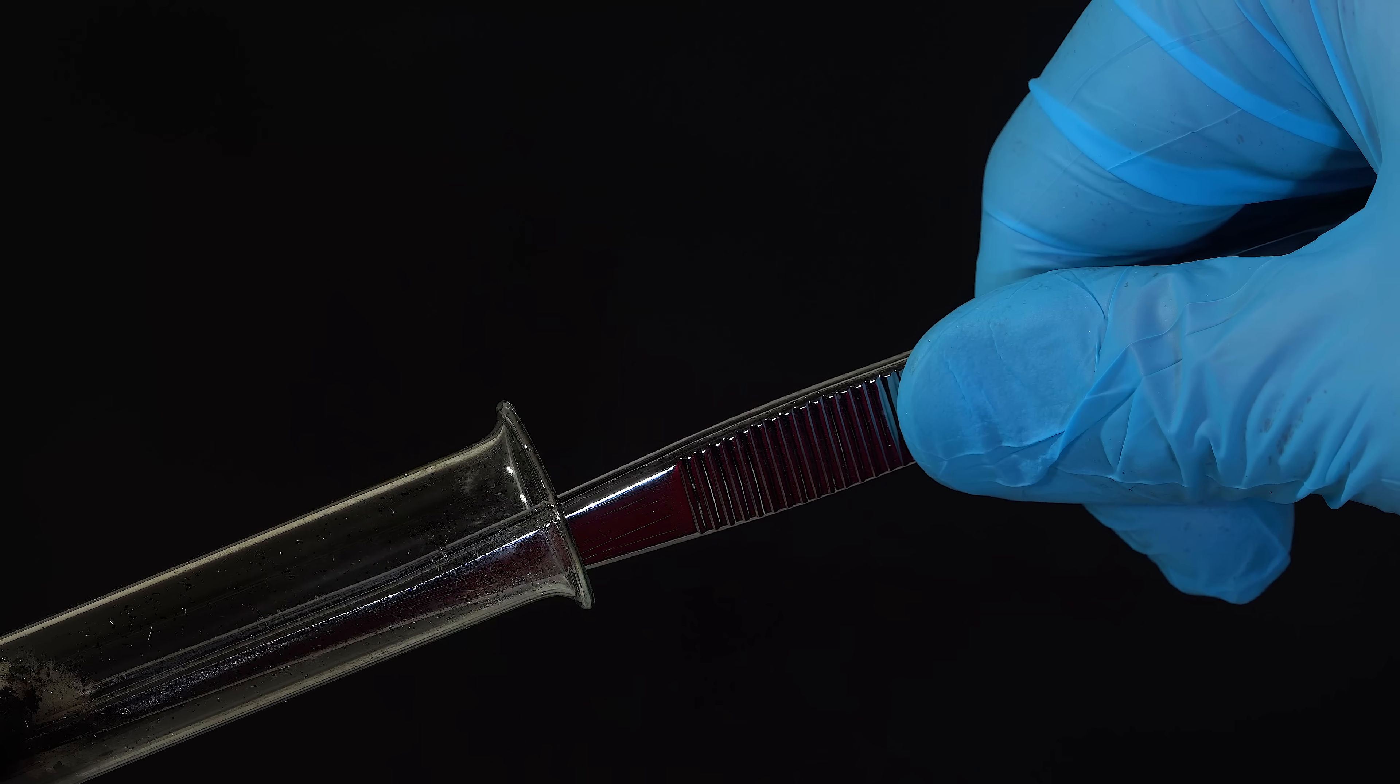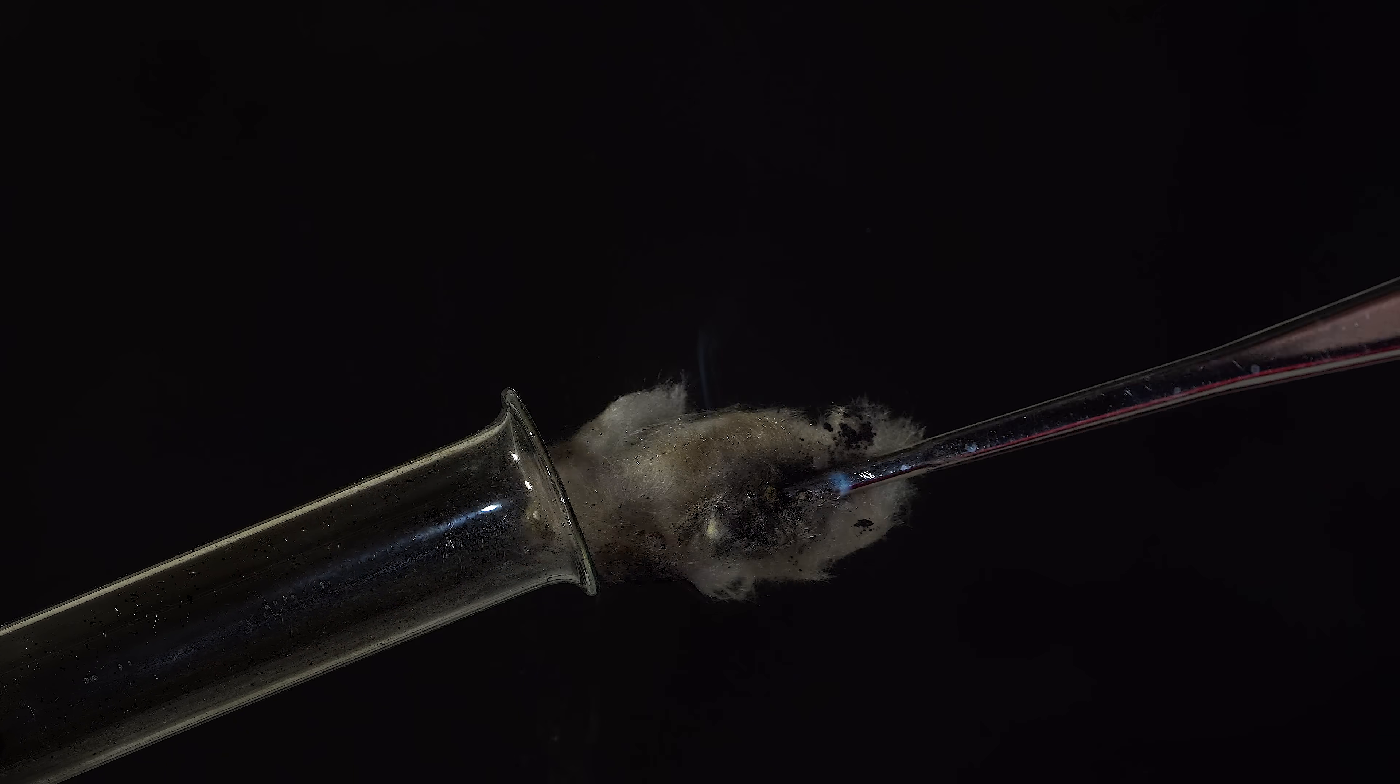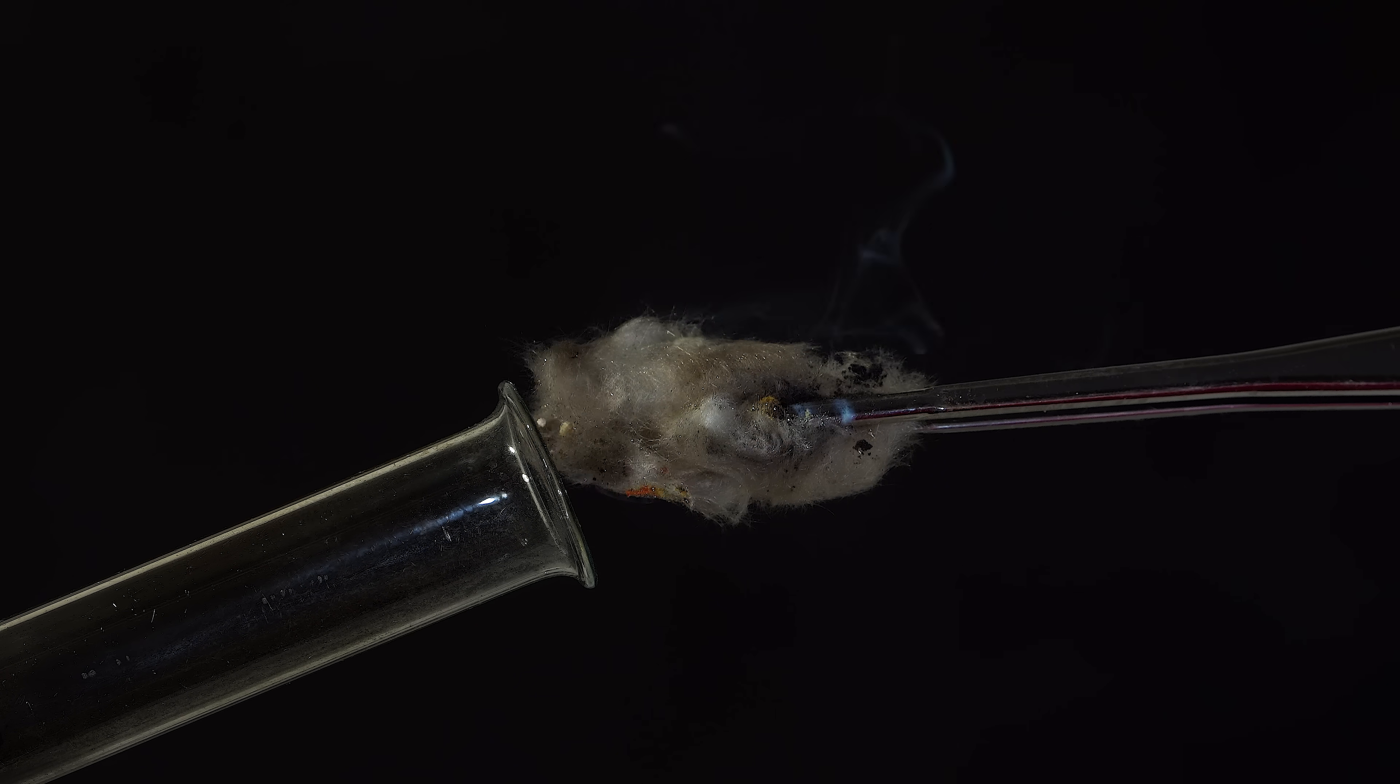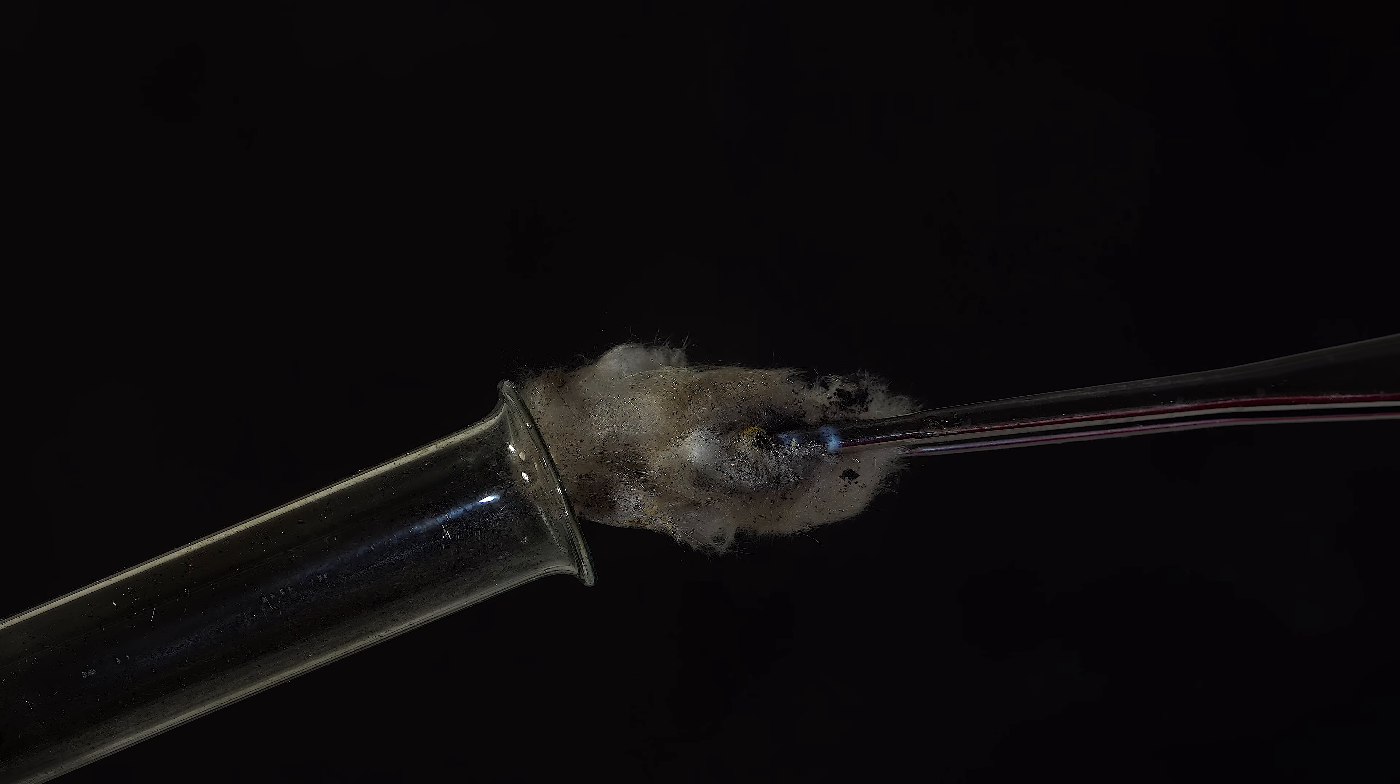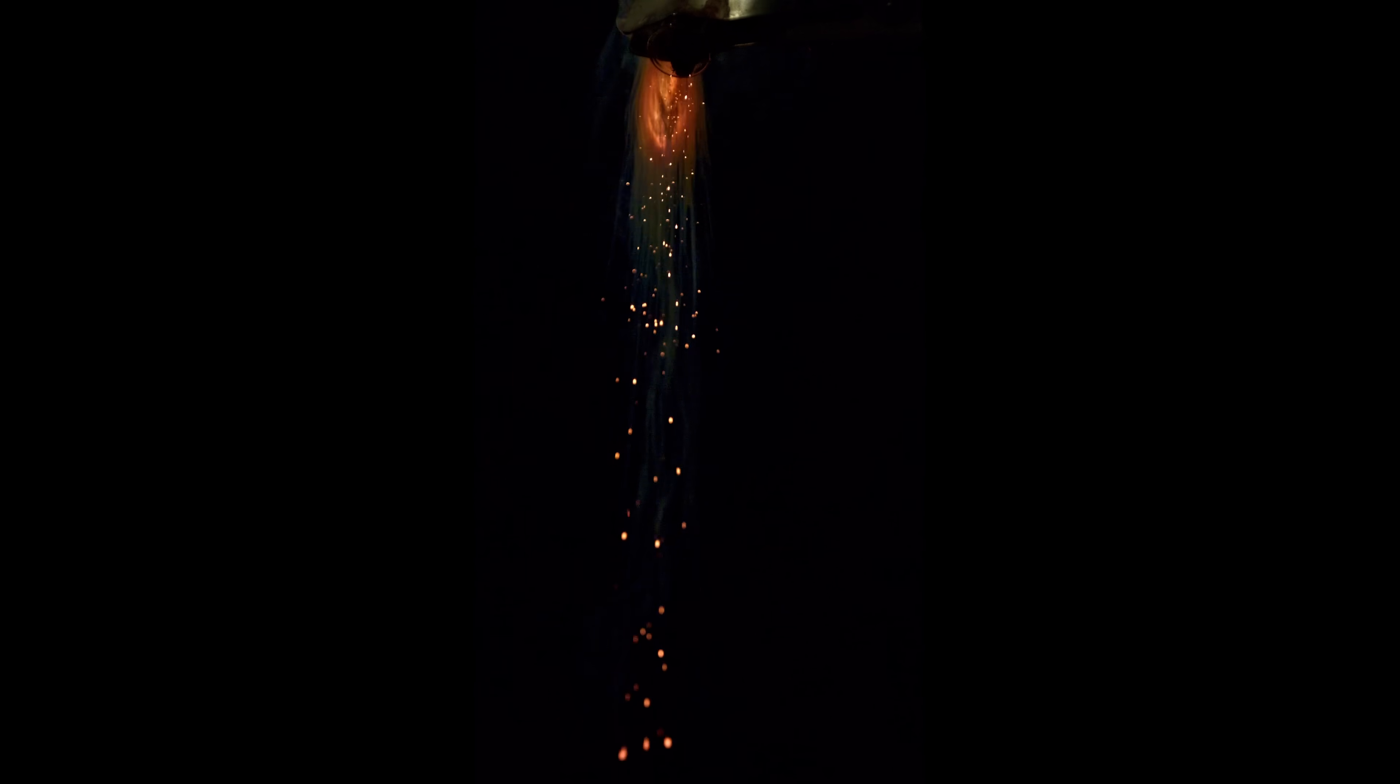As soon as the cotton wool is removed, you'll notice sparks and smoke. Now I'll pour reaction products out of the test tube. Against a black background, the sparks generated during the combustion of lead powder are clearly visible.